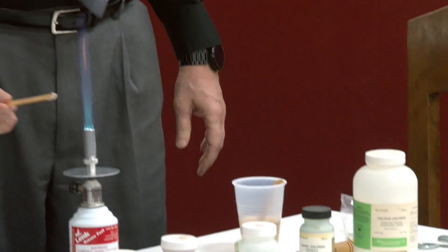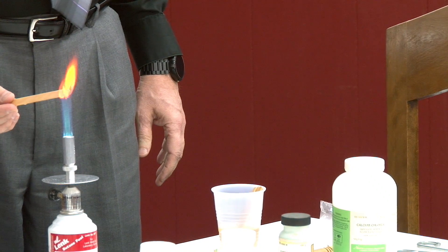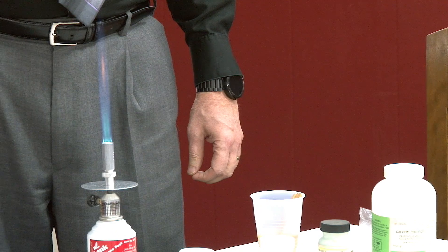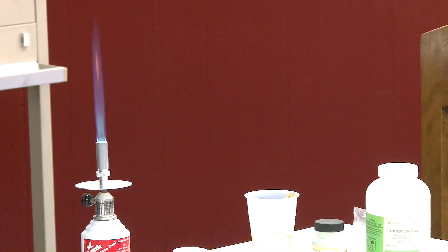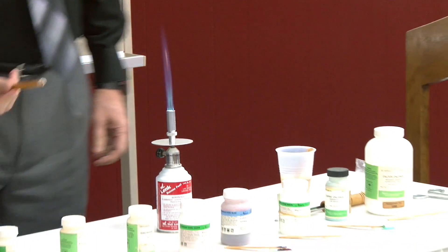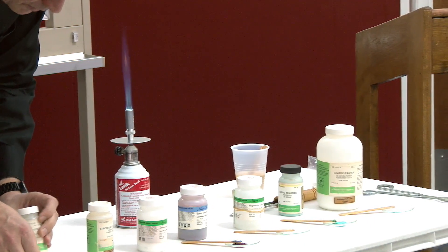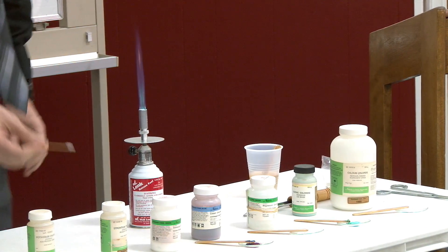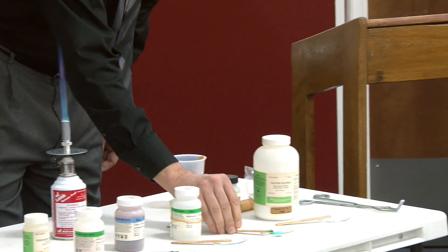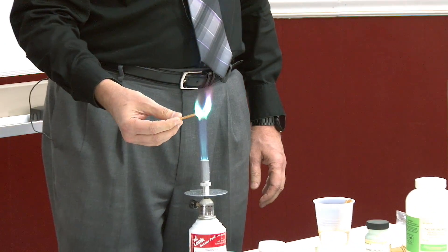Calcium. Any of those you really liked that you want me to do again? The blue one. Lithium? Oh, that was red. Which one was blue? Potassium — the actual blue one, the blue powder. The lavender. Copper.